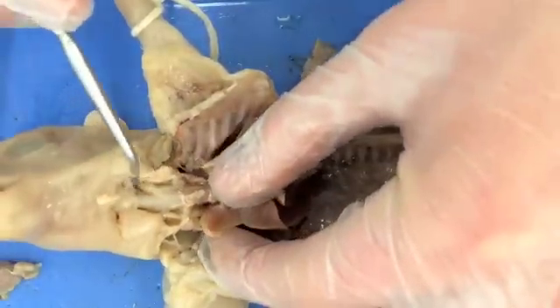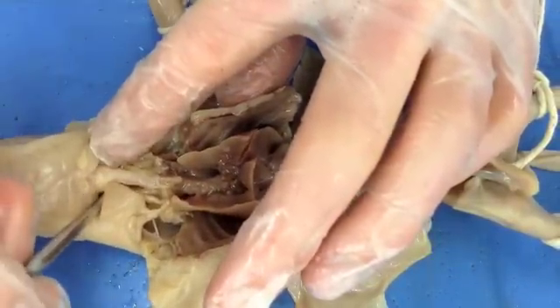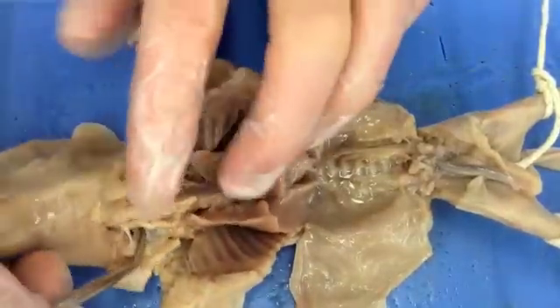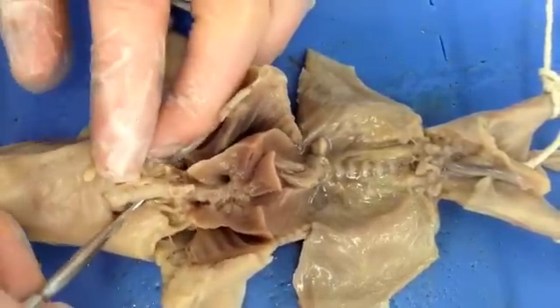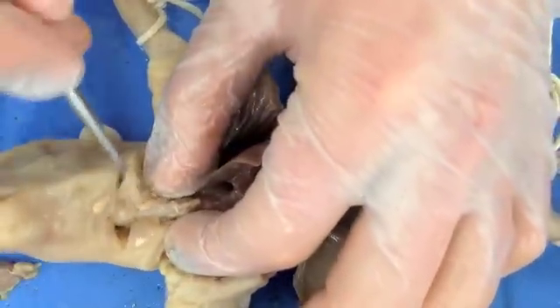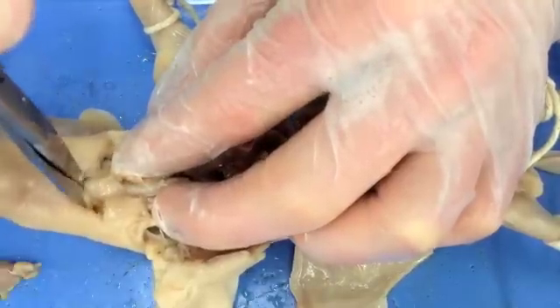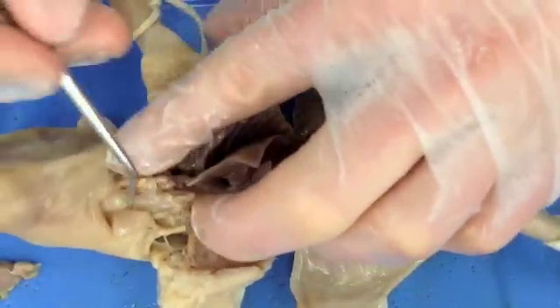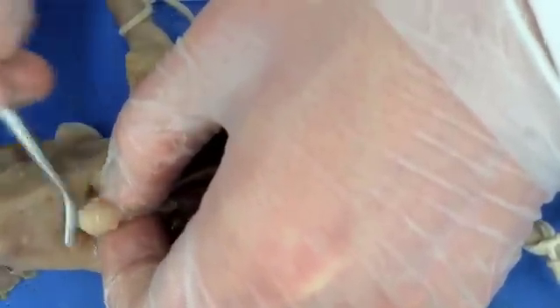What we're going to do now is remove from the pharynx-larynx region — we're going to cut that out and remove the lungs. Before we do that, though, we can see from this angle that directly connected underneath is going to be your esophagus, which may be a little bit easier to see once we remove everything. A little snip here, cutting back, just removing connective tissue.